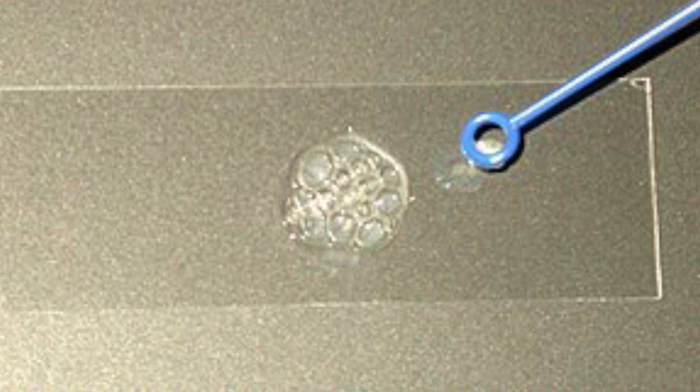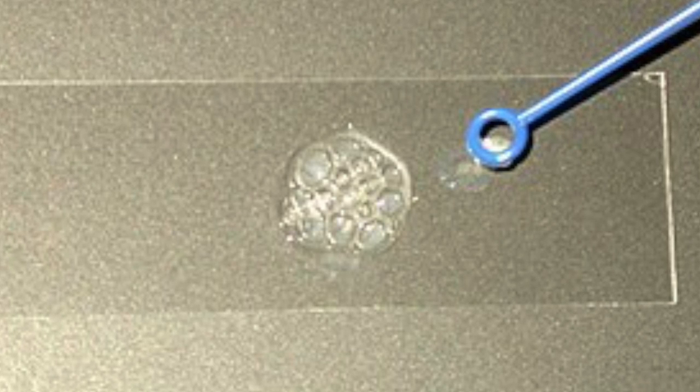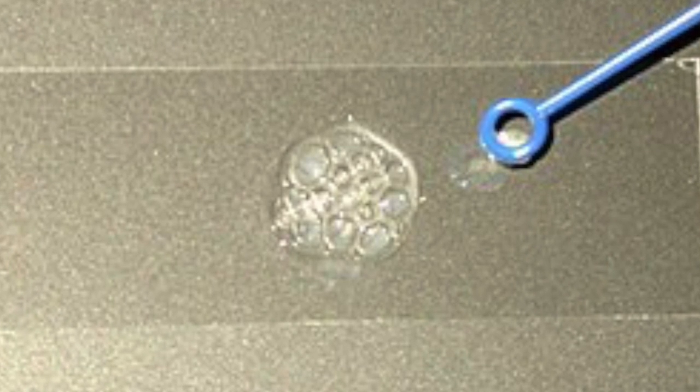The fourth test we did was the catalase test, which came back positive because there were bubbles that appeared, meaning when we added hydrogen peroxide to our unknown, the hydrogen peroxide was broken down into H2O and O2. The O2 was released through the bubbles that were formed. The fifth test we ran was the oxidase test, which came back negative. When we placed the oxidase reagent on our unknown, it didn't turn purple, meaning our unknown bacteria didn't produce the enzyme cytochrome oxidase.